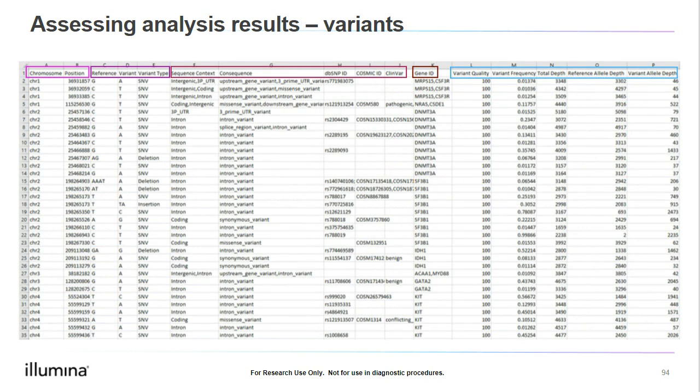Opening up the variant table.txt, we see a list of all of our variants. So I'll review the columns here. So first, starting at the left, we see the chromosome and base position, followed by the reference base and the variant, so the alternate or difference from the reference. We have a column that tells us the variant type, so if it's an SNV, insertion, or deletion. Then we have additional columns that give us further information about the variant location and clinical consequences for each variant. We see the gene that holds the variants and additional metrics regarding the variant, including variant coverage or depth.